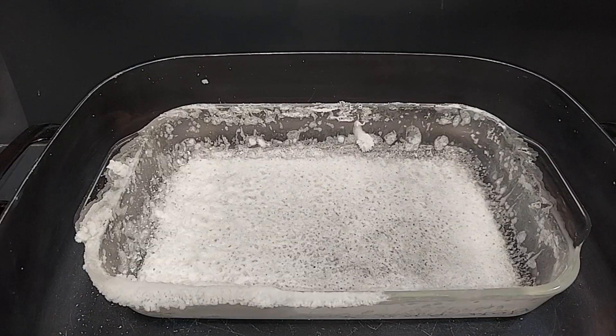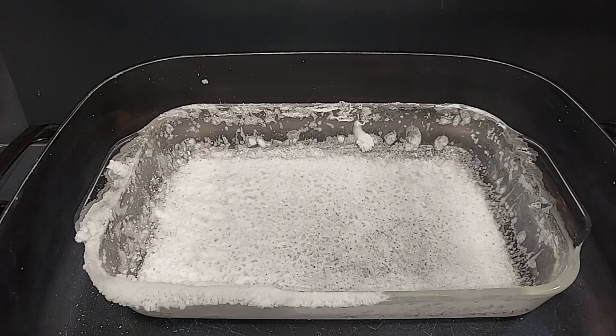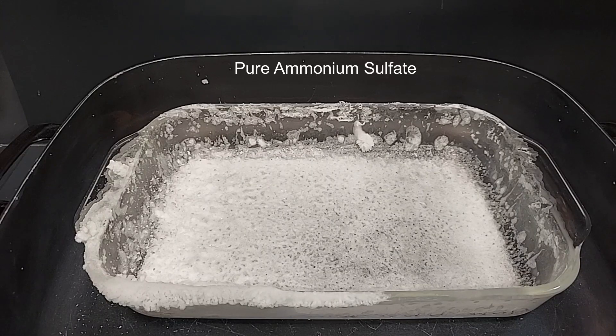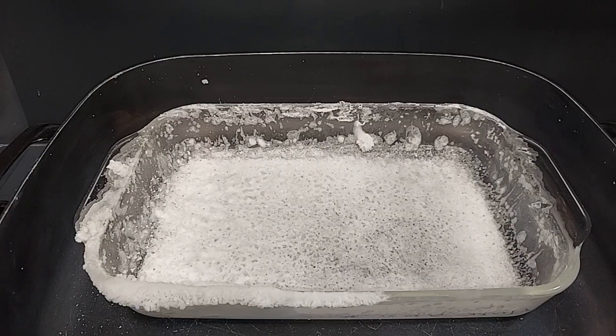Well this certainly looks very different from what you just saw when I was doing the time lapse. I thought it was done crystallizing so I turned it off and was going to start scraping stuff out, and there was a layer of water under everything I couldn't see at first. So I went ahead and heated it some more and this is how it actually looks when it's completely dehydrated. It is still a little bit warm. I'm gonna wait for it to cool down now.